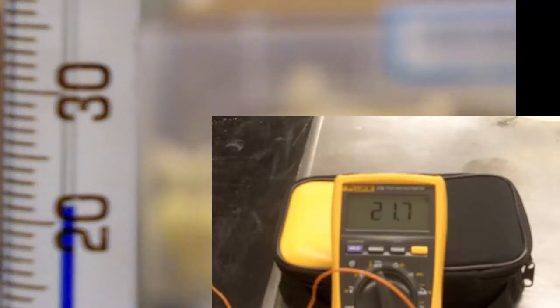The thermometer is a much slower reading of temperature than the thermocouple. The thermocouple will give us the actual temperature and we're going to see how much the thermometer lags behind it. We're going to go up to about 100 degrees, zooming out a little on the thermometer so you can see it around the 100 degree mark.